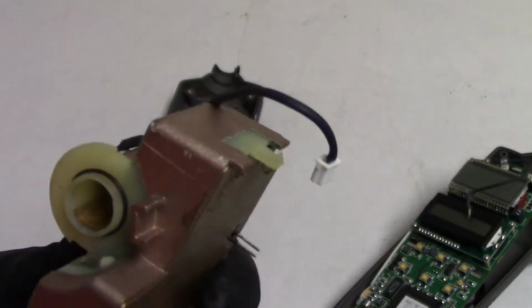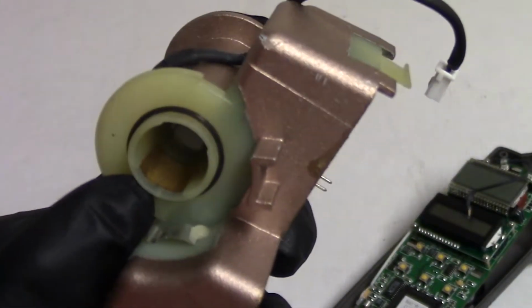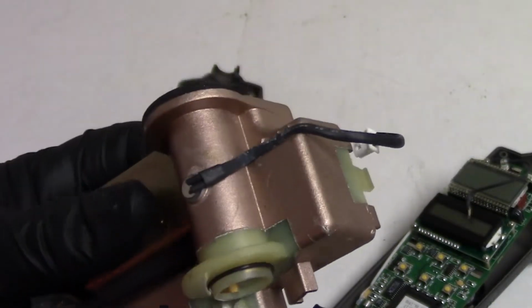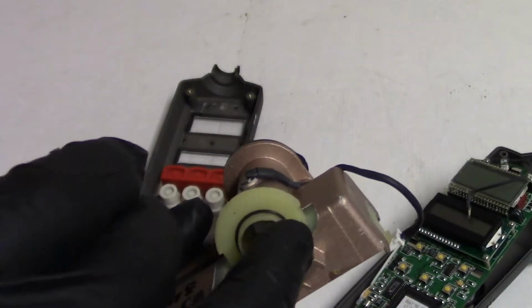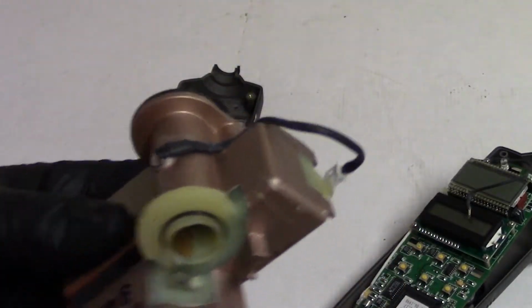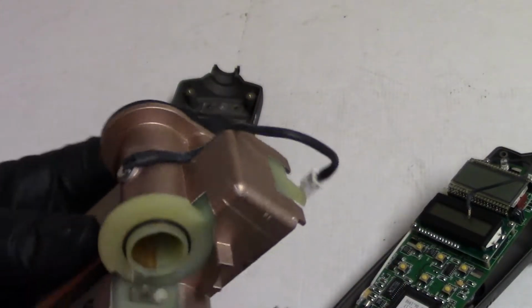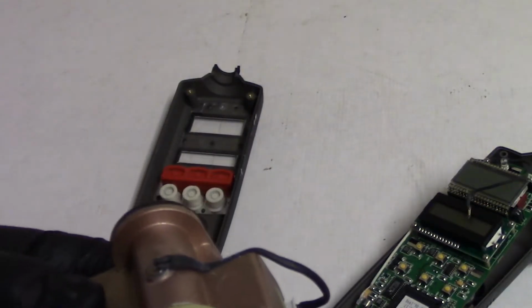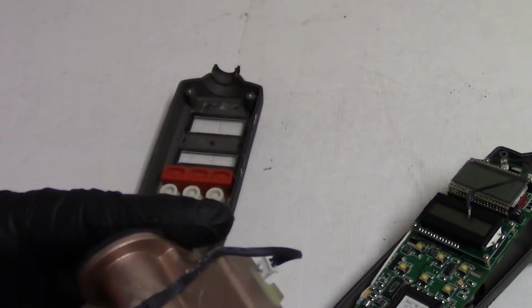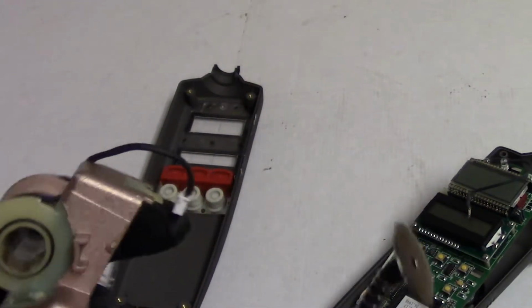Oh, I see more. Okay. We have an electrode there and an electrode there. So I'll bet you that's for the UV light. I'll bet you those two electrodes are for the UV light. This is probably a transformer in here. It's, I mean, it's heavy. So it's definitely doing something. Okay, so that goes this way.